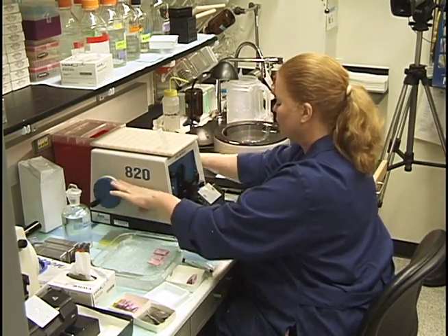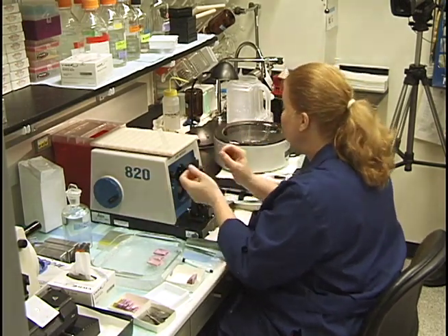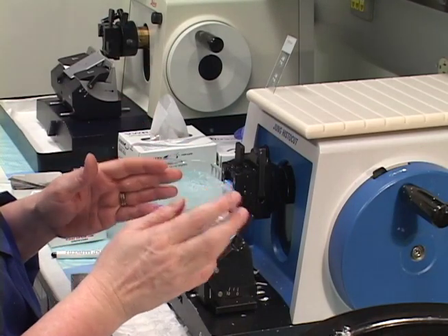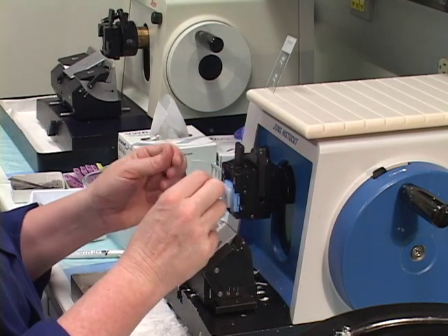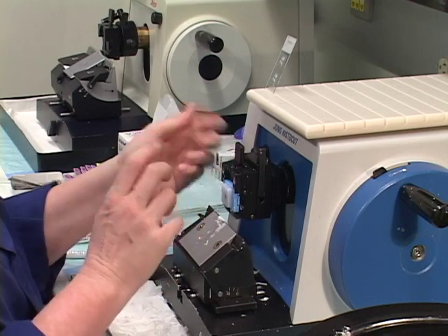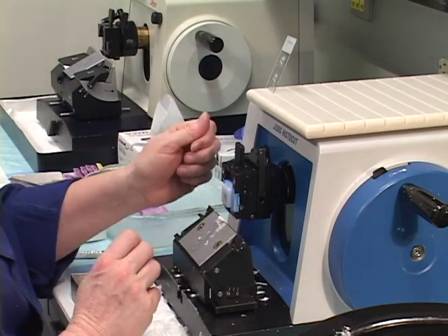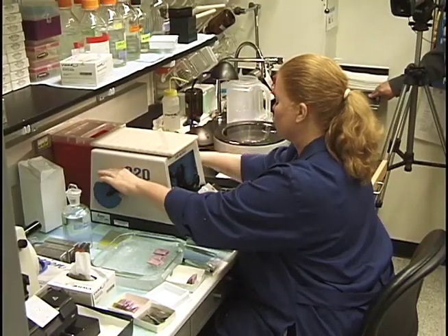To summarize the block turning alignment method: if when you flip the block it's way off to one side, you only tilt it halfway — because when you flip it again it's the other half. You won't do the full amount you think it might need; you'll see what I mean when you're actually doing it.